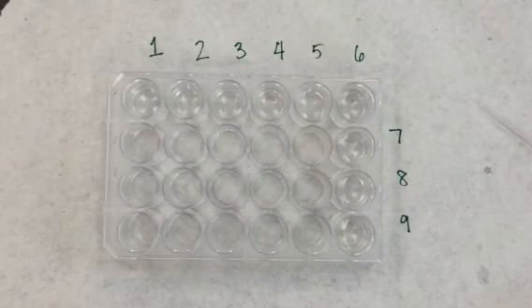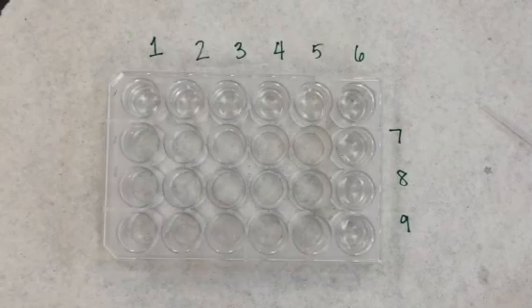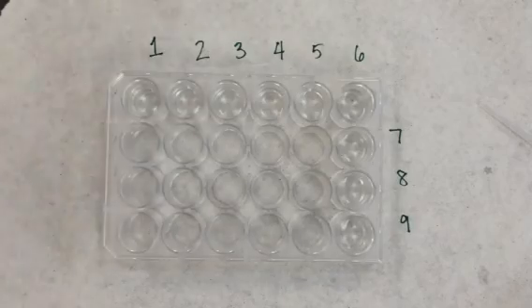Okay, so I've diluted my 1 molar hydrochloric acid 8 times for a total of 9 different concentrations. Next I'm going to add I think 2 drops of universal indicator to each one of these solutions, and we're going to see what color they each turn into.